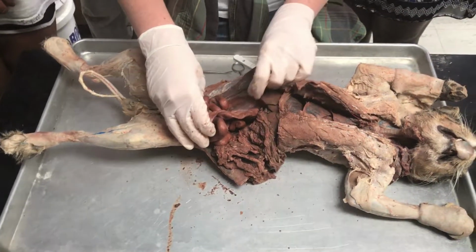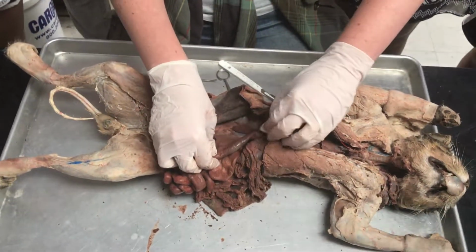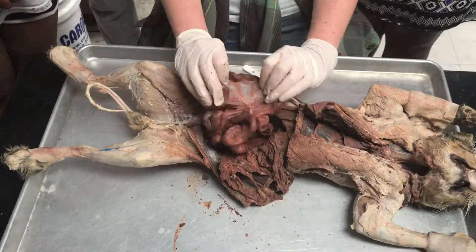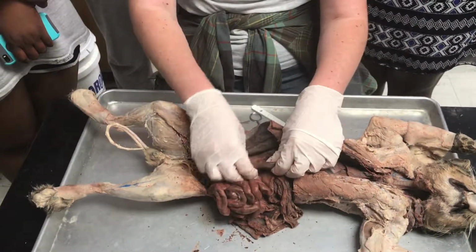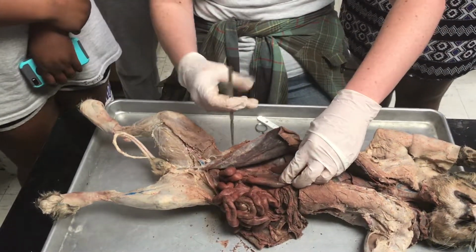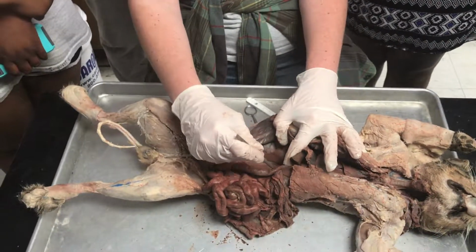So now the accessory organs. The most important is the pancreas. So if you look in the middle of the intestines, you have what's called mesentery. It's this thin, sort of see-through structure that holds all the intestines together. But when you come over here next to the duodenum, you see it's not really completely see-through. There's this chunk of, it's an organ here.